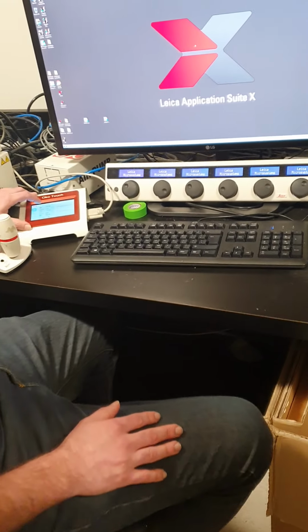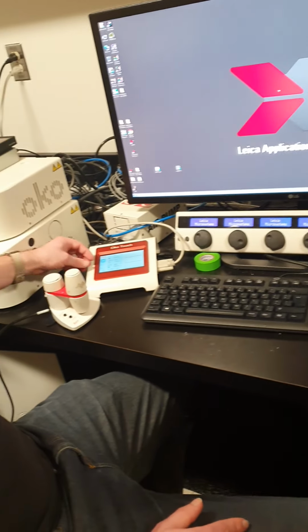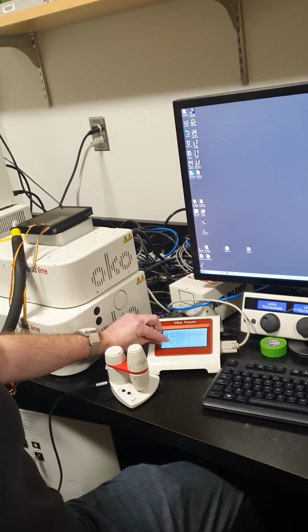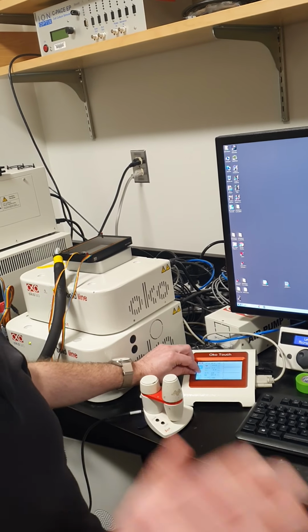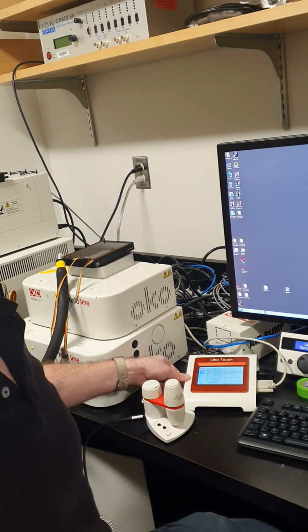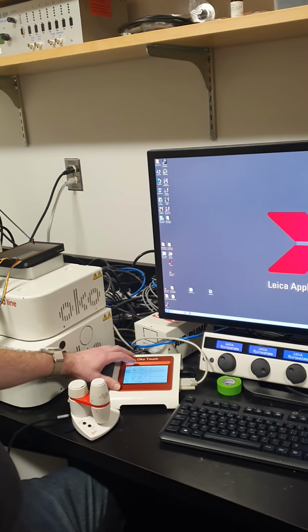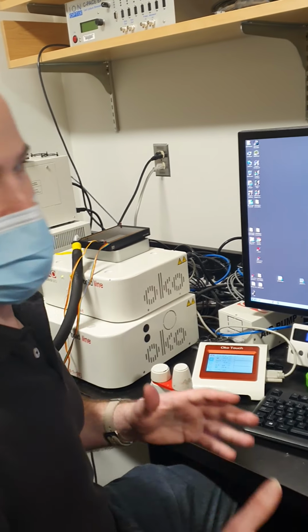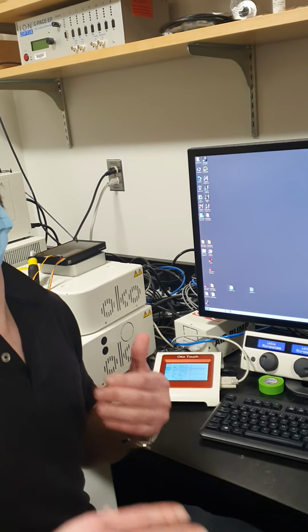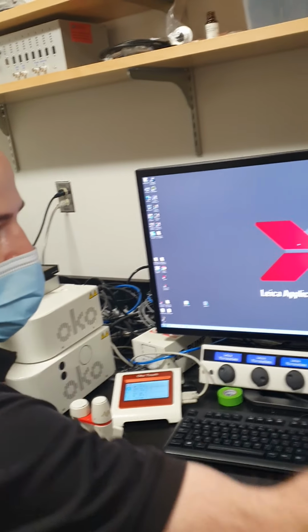And you can just click on them and change the set point to whatever you want. Say, for example, you were doing a hypoxia experiment, then instead of being 20% oxygen, you can reduce this all the way down to 1% oxygen. And then once it gets going, you'll see it'll have graphs, and you usually just give it a couple minutes for everything to stabilize before you put your cells in. And it's run off of gas cylinders here, plus the room air.